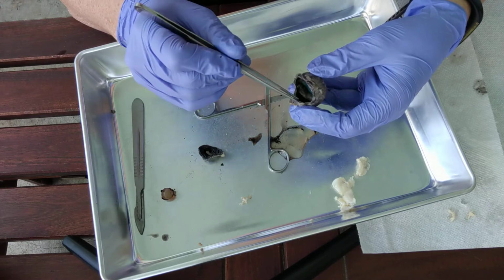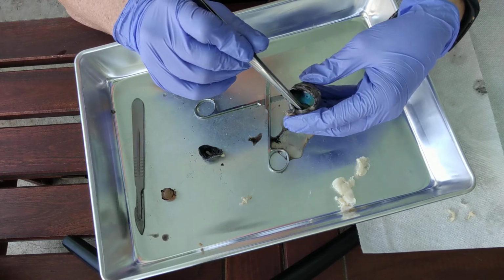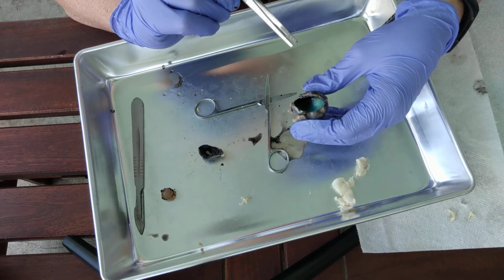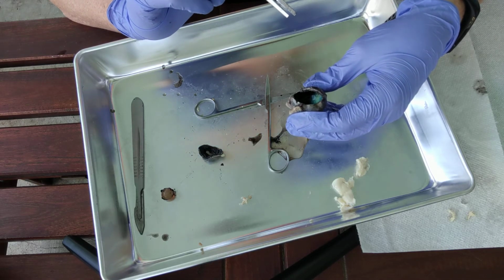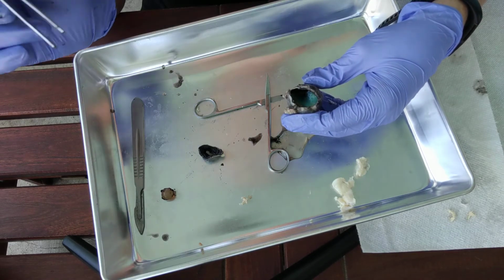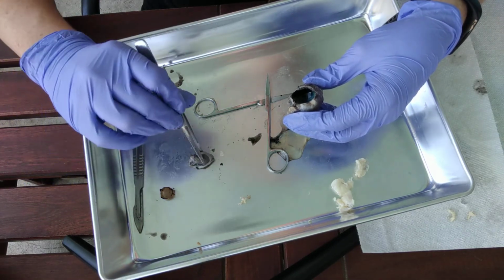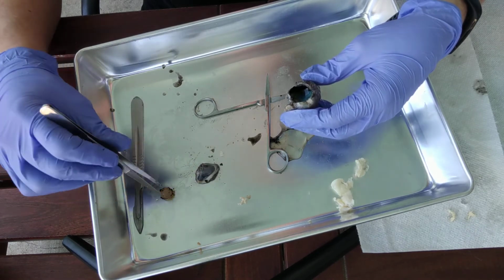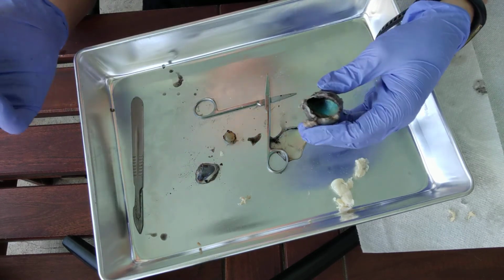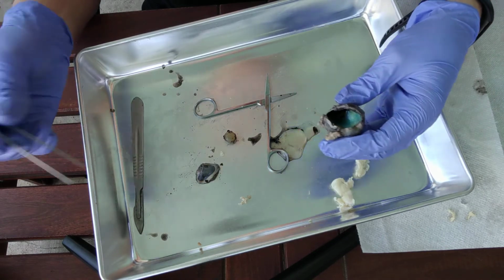Now the choroid for humans would be all black, but if you'll notice when we look in the sheep eye, instead of being all black, it has a really shiny surface. That iridescent sheen is called the tapetum lucidum. What that does is it allows them to see better in the dark, because as the light goes through the cornea, through the pupil, refracted by the lens, it's going to bounce around a little bit more. That'll activate more of those rods, and that'll make it so that it can see better at night than humans can.